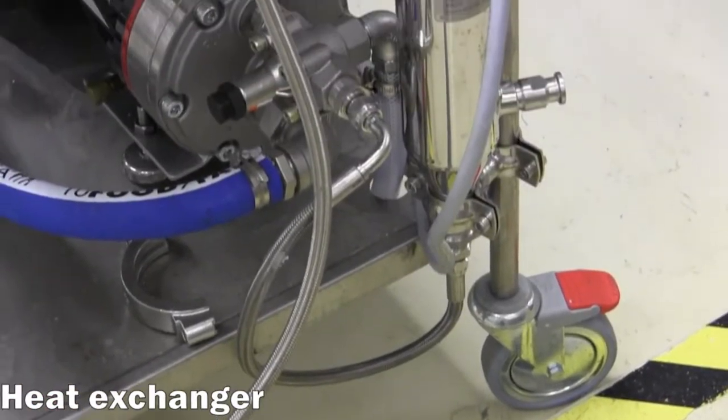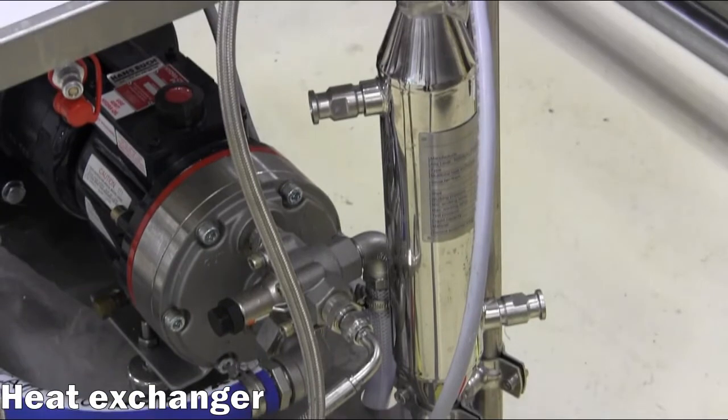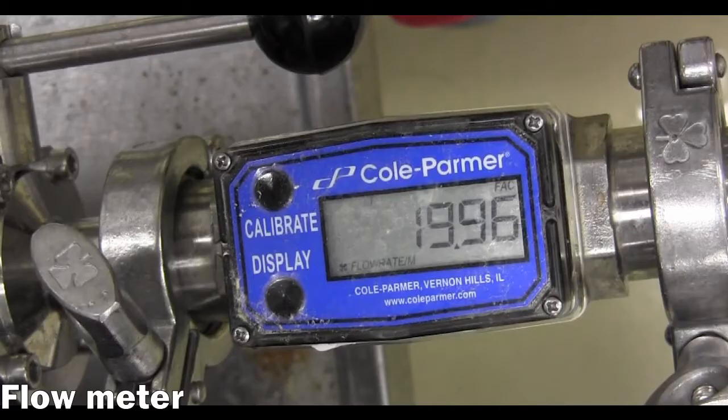Optionally, the feed material can be routed through a heat exchanger to provide cooling to sensitive materials before entering the membrane housings. Considerable heat is generated over time as the feed material is pumped through narrow channels at high flow rates.